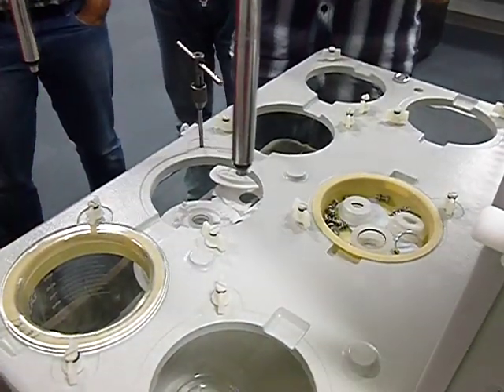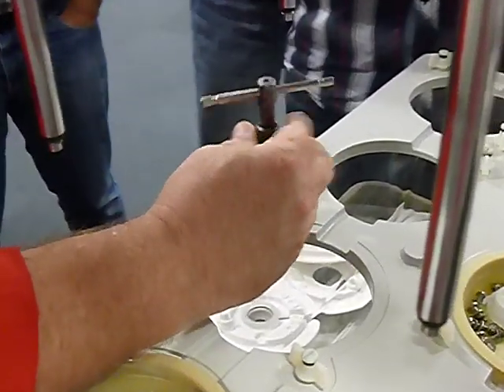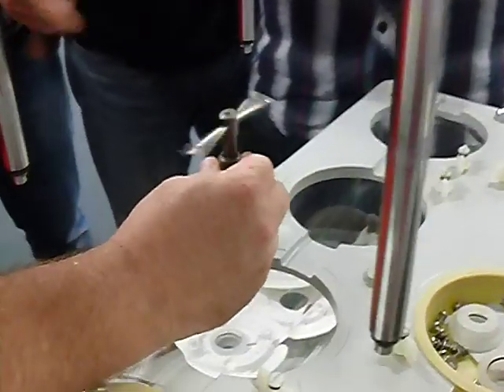Whenever you take one of these off and replace it, I always recommend running your threads through it again. Is this metric to make sure it's clean? In inches? Imperial.